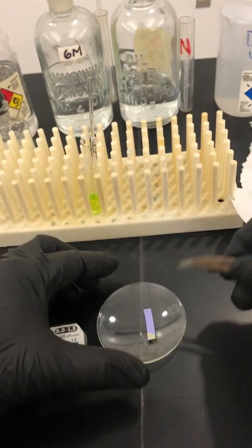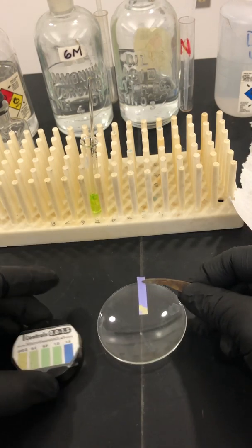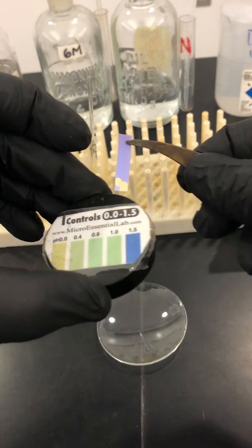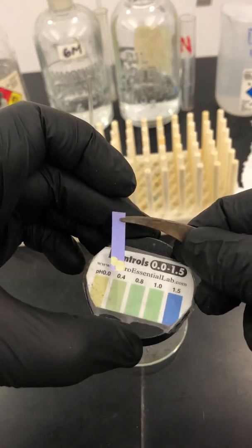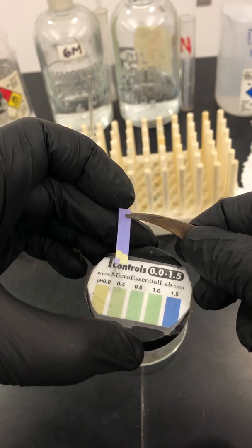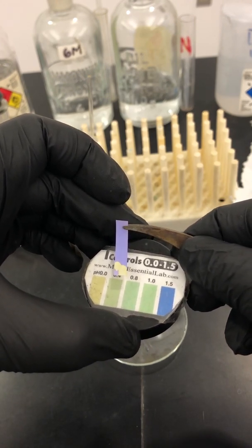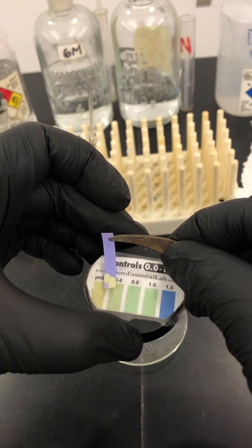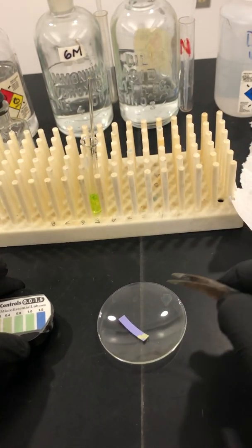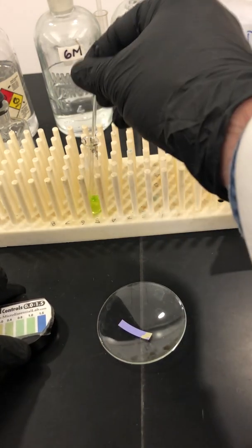Although it's going to be hard here on the video because of the color conversion, I want to bring it over here next to my key and see if it's somewhere where I need it to be. I need it to be somewhere around 0.5. Let's say, for example, it got a little too acidic. So what I want to do in that case is neutralize some of the excess acid.